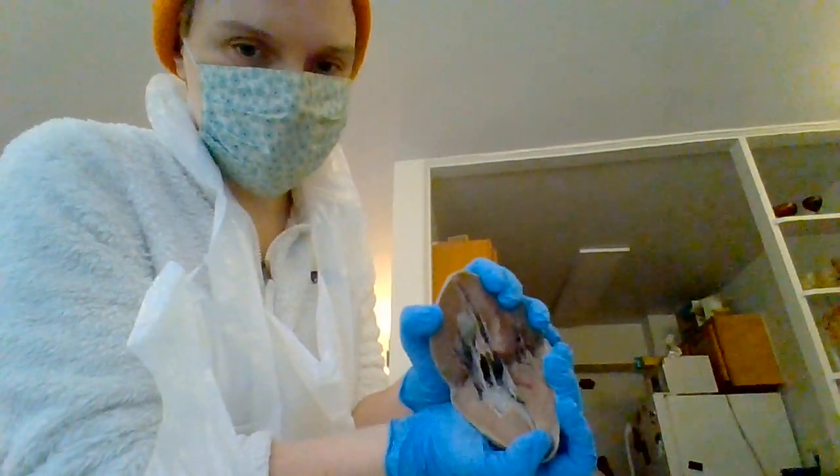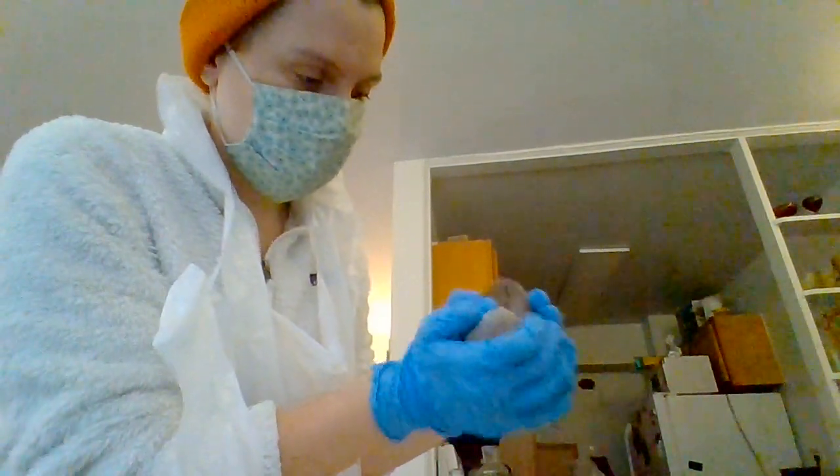How wild is it that we can just pry it open like that? Bananas. So I hope that was clear. I really shouldn't have taken that glove off.